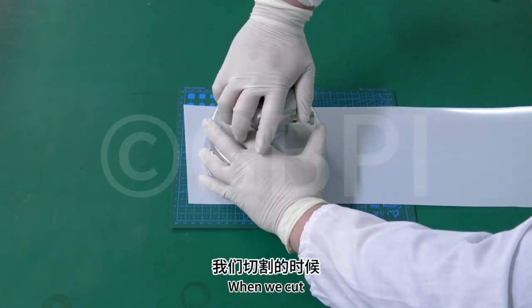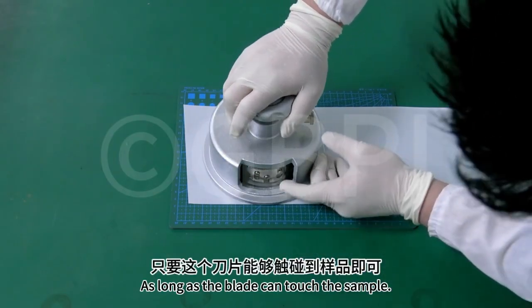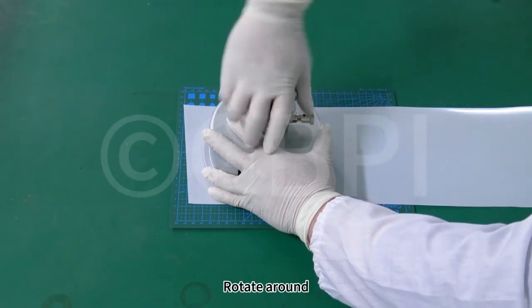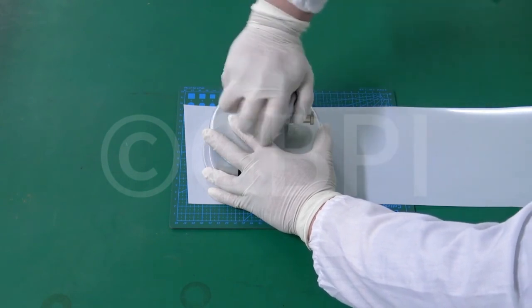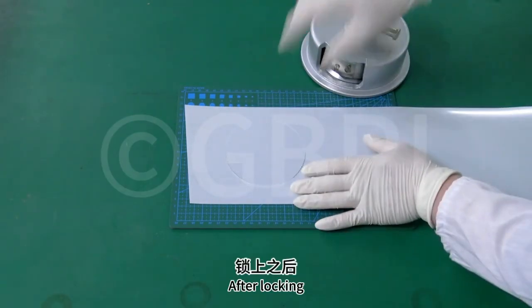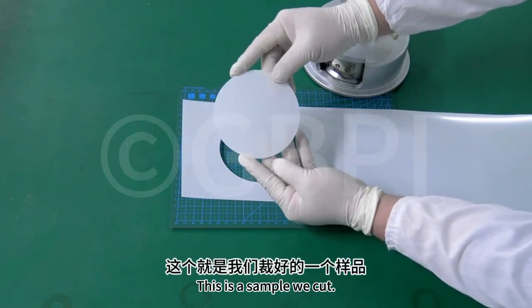When we cut, don't press too hard. As long as the blade can touch the sample, then press, rotate around. After one rotation, let's lock this safety buckle first. After locking, then take off our cut sample. This is a sample we cut.